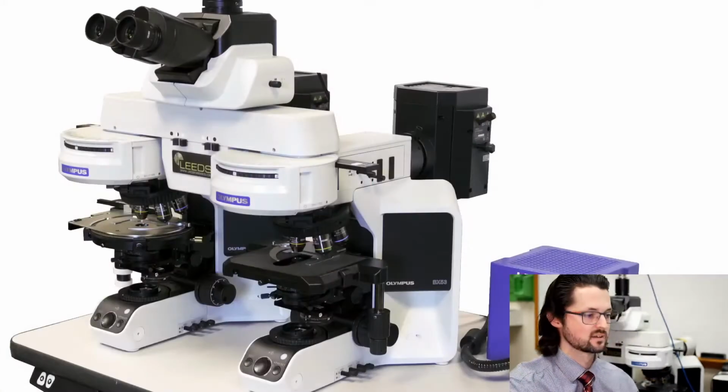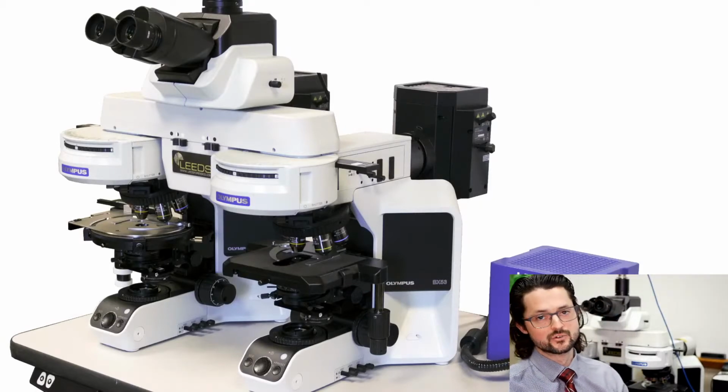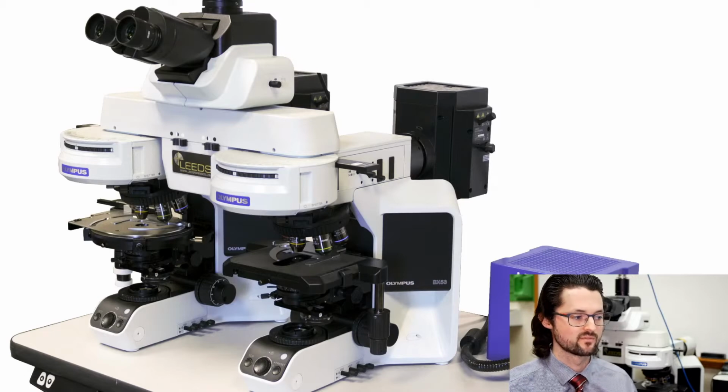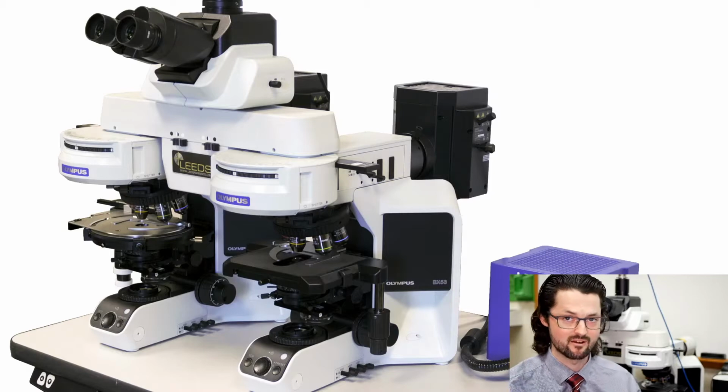So now let's talk a little bit about fluorescence illumination. For fluorescence illumination, we also saw the same thing. The picture I'm showing you right here is one of our LCT comparison microscopes that has been equipped with a mercury burner, or a mercury light source. Essentially, a mercury light source has been the gold standard for as long as I've been in microscopy, and certainly longer than that. It's been used for fluorescence microscopy for basically about ever, as far as I'm aware.